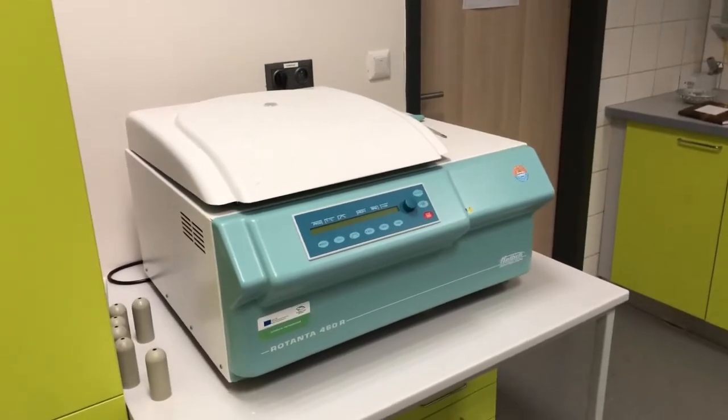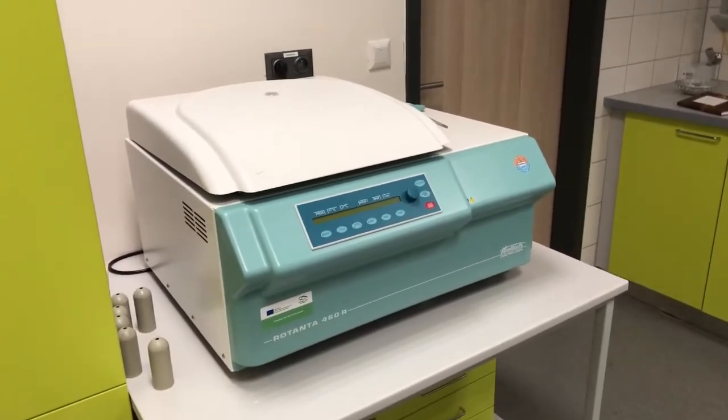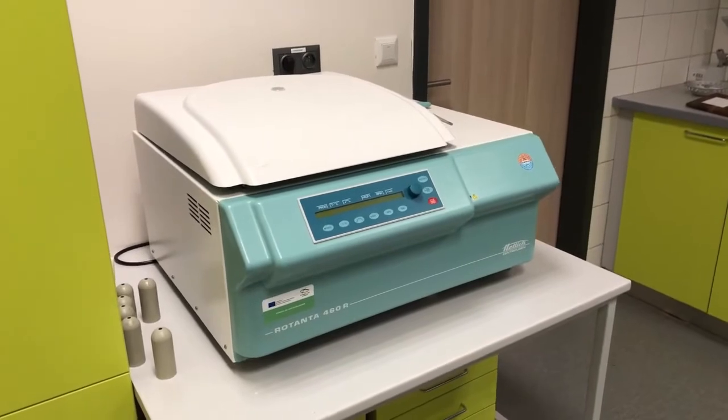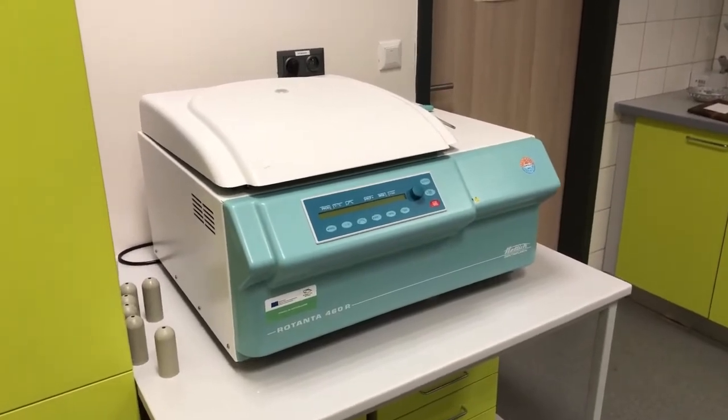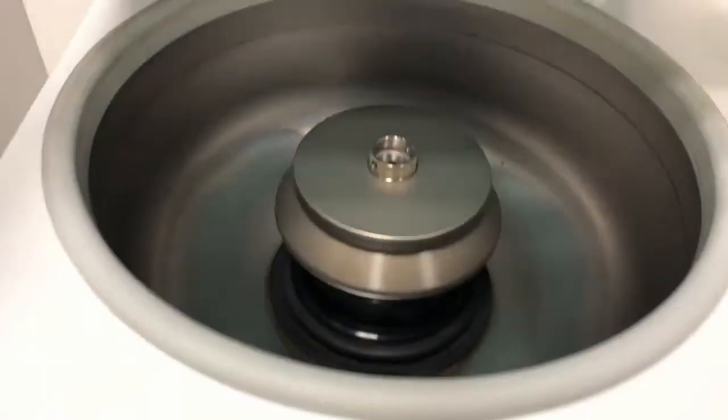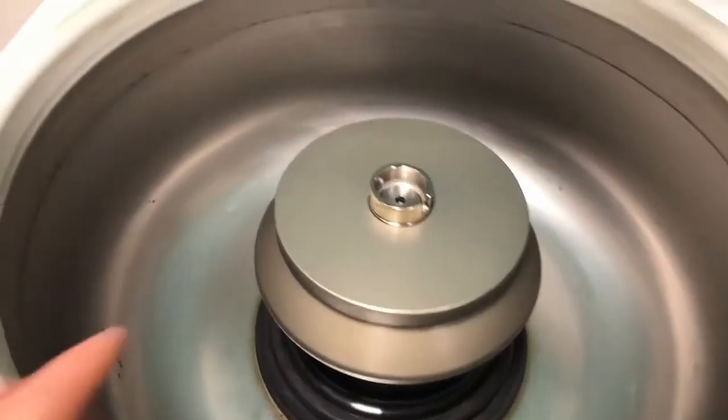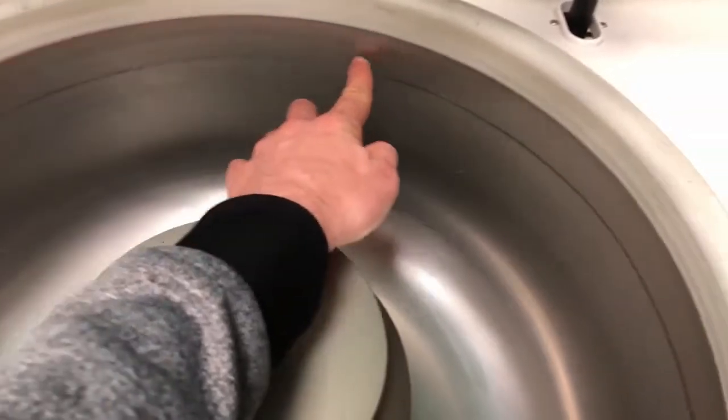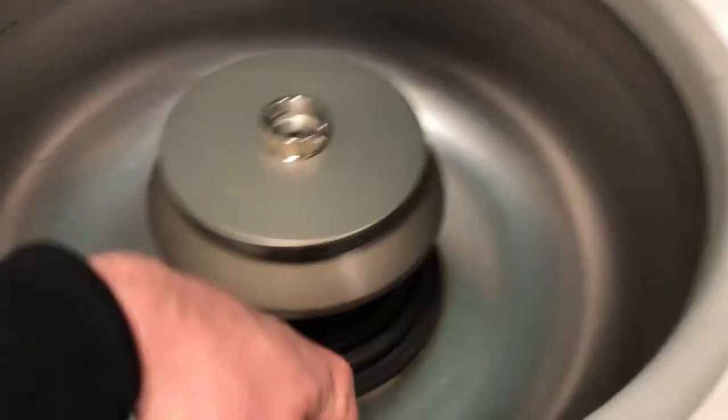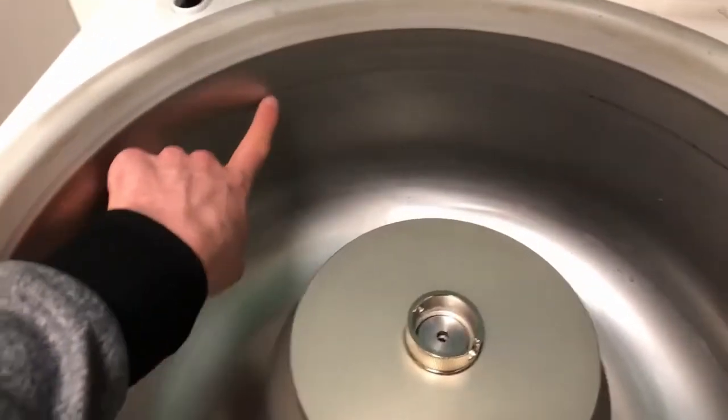Okay, first things first. Before you start your laboratory work, be sure that everything works well. That means check the socket, check the rotor and inside of the machine, because you never know who worked before you. Maybe there is some damage or mess like you did last week, remember? Just kidding. Or not?